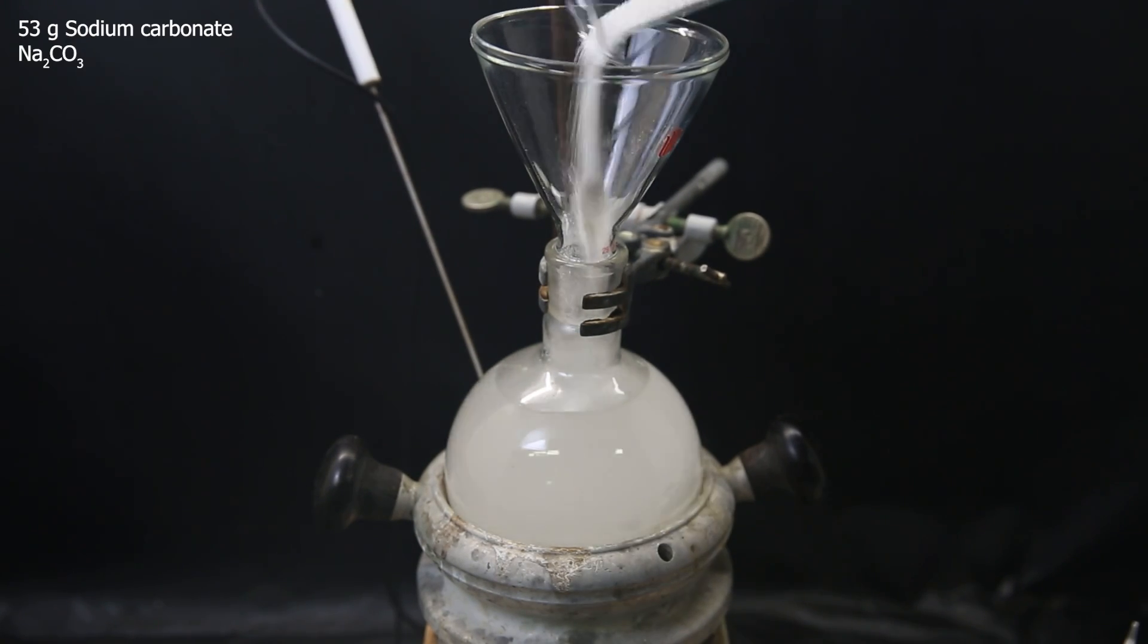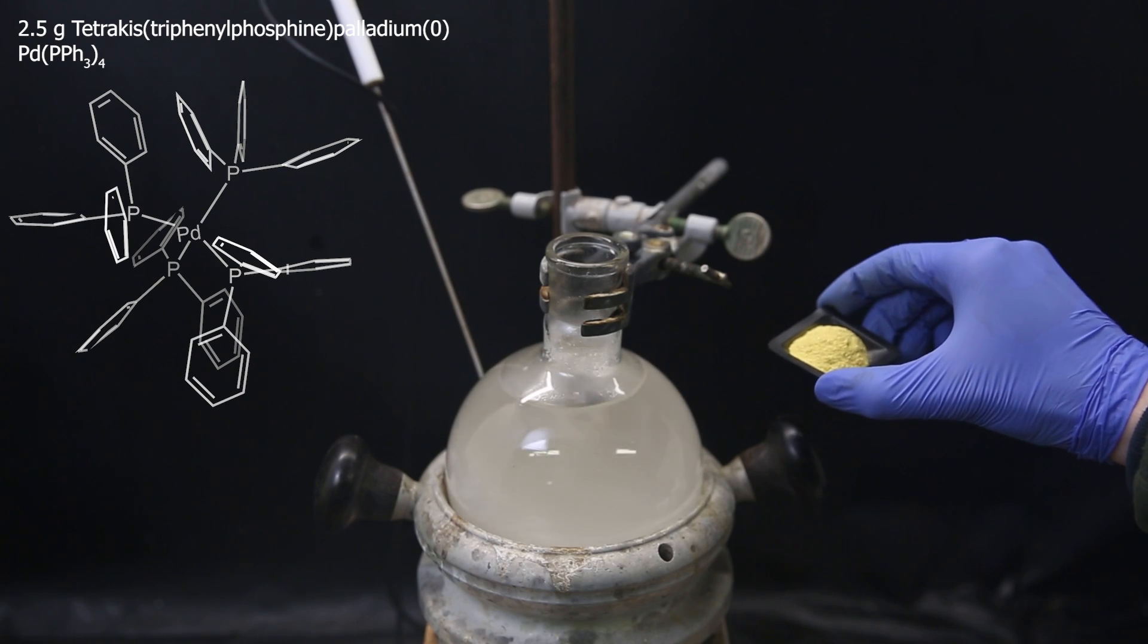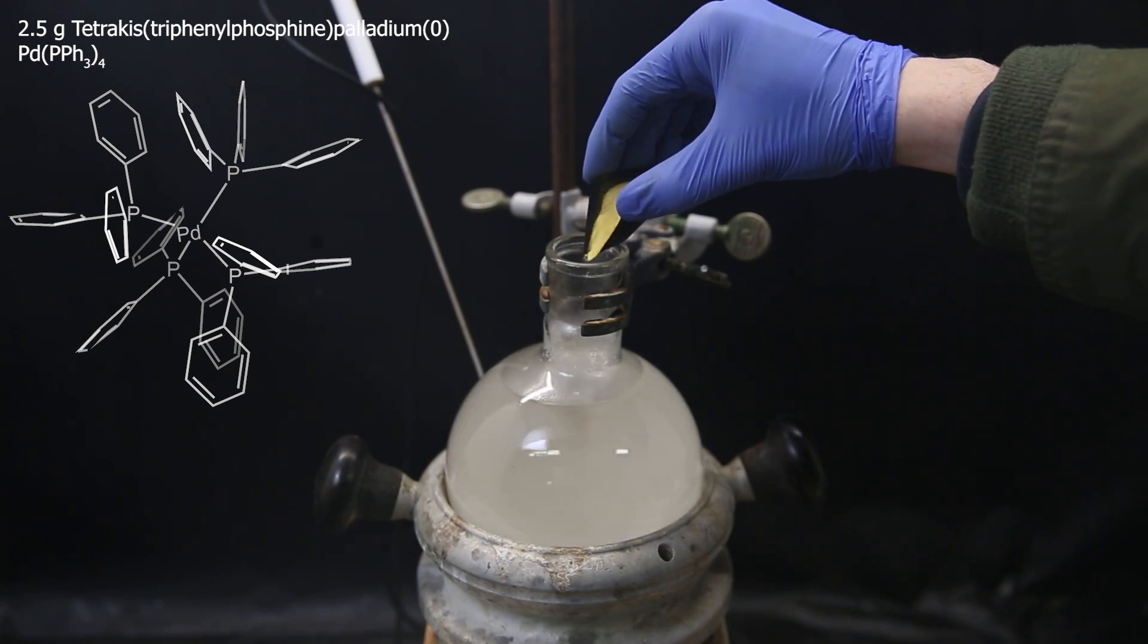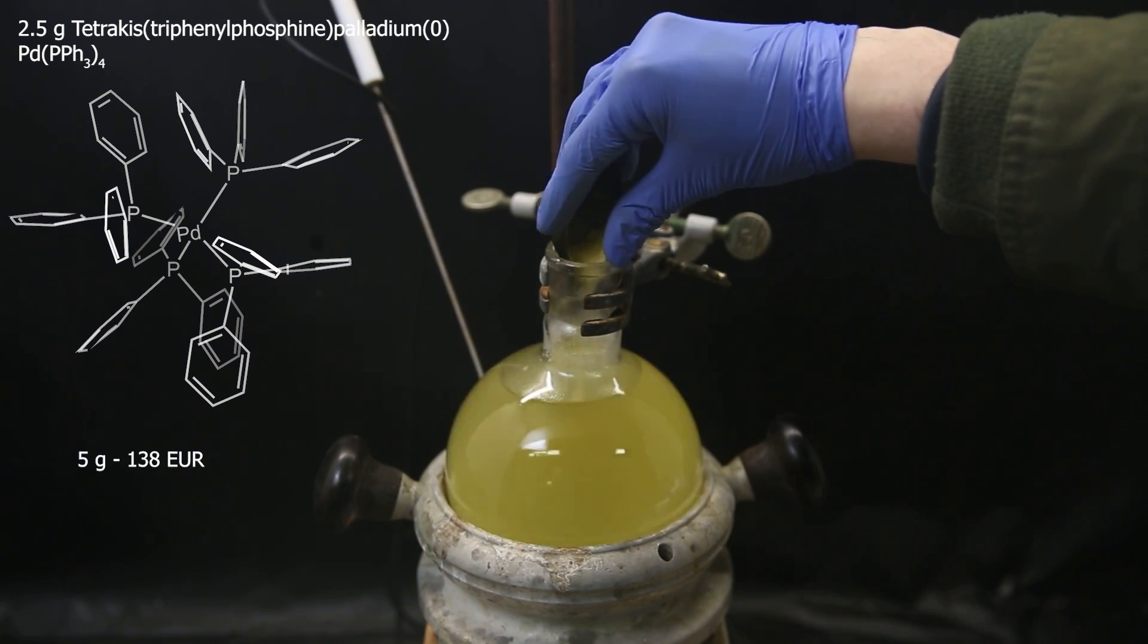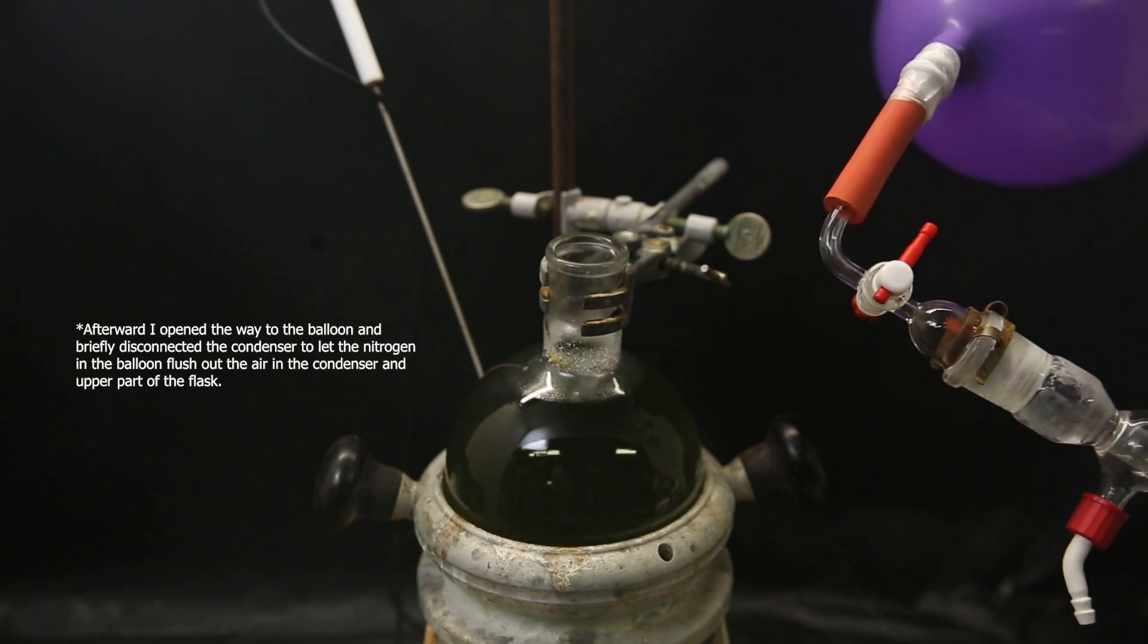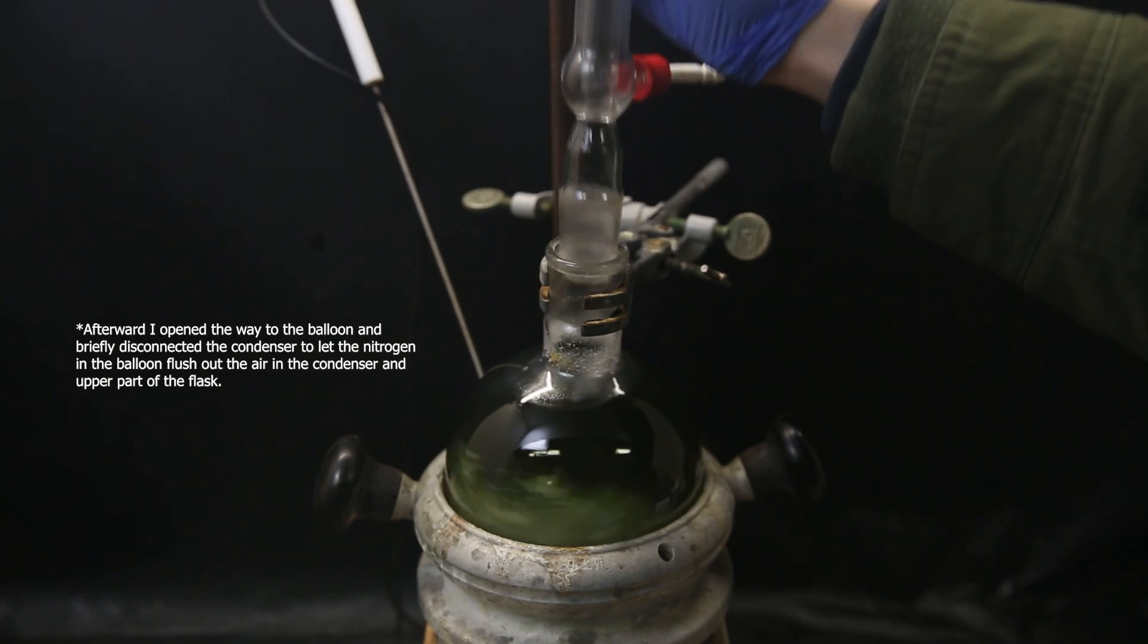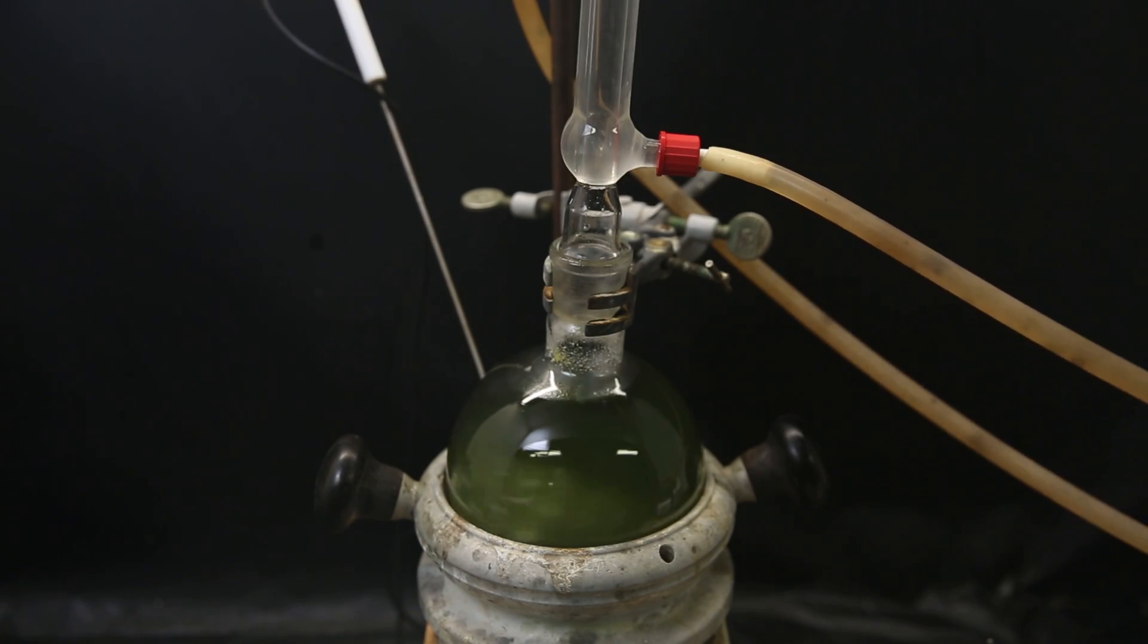And as the catalyst, 2.5 grams of tetrakis triphenylphosphine palladium(0), which is probably the most expensive reagent in the whole synthesis. The reaction immediately turns green, and I quickly attach a condenser with a nitrogen balloon on top to keep it under an inert atmosphere. I heat this mixture to a boil and let it reflux for 18 hours.